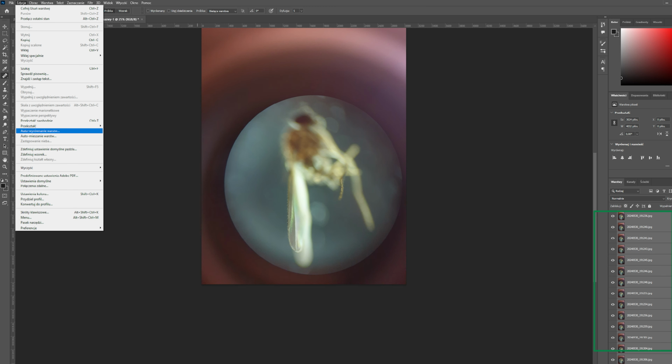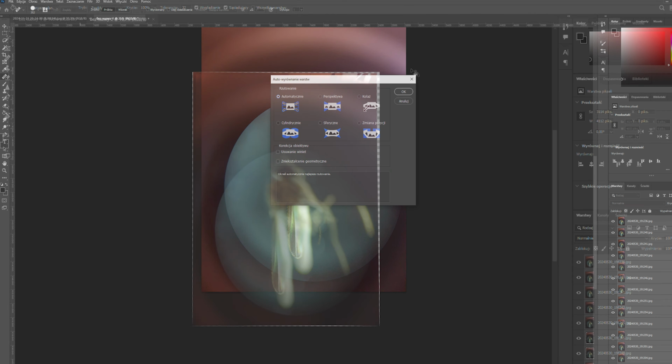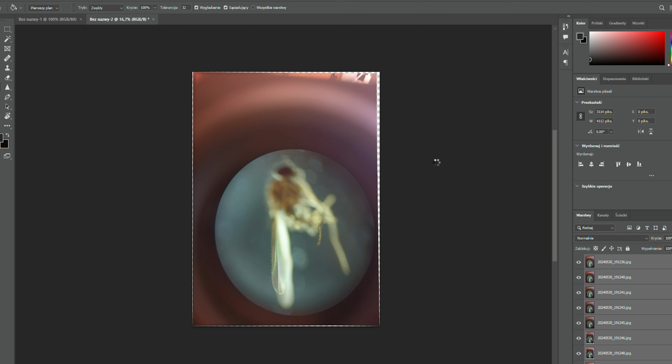Next, select All Layers and go to Edit and Auto-Align Layers, using the Auto method. This helps eliminate any small shifts. Then go to Edit and Auto-Blend Layers, choose Stack Images, and click OK. Now Photoshop will process the stack to create one composite image. This can sometimes take quite a while. Thanks to the magic of editing, it only took a second for you, and now you can see the result.